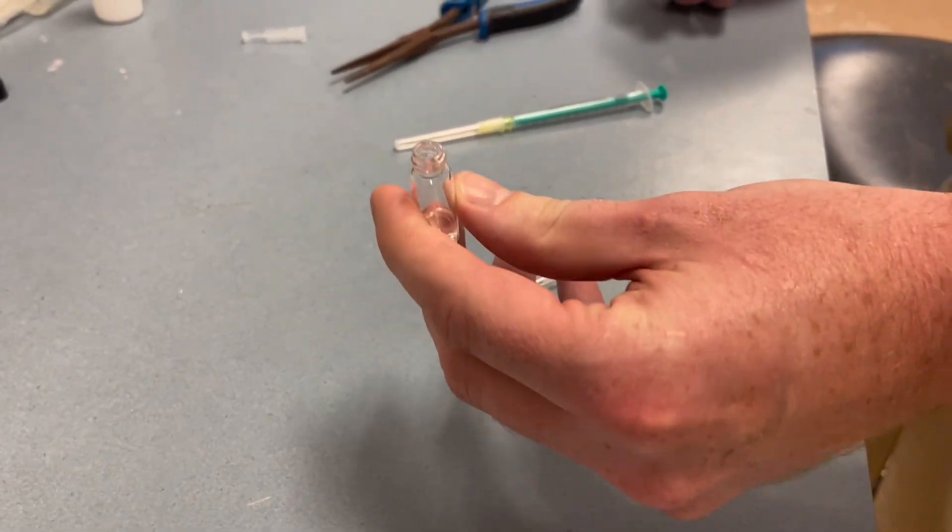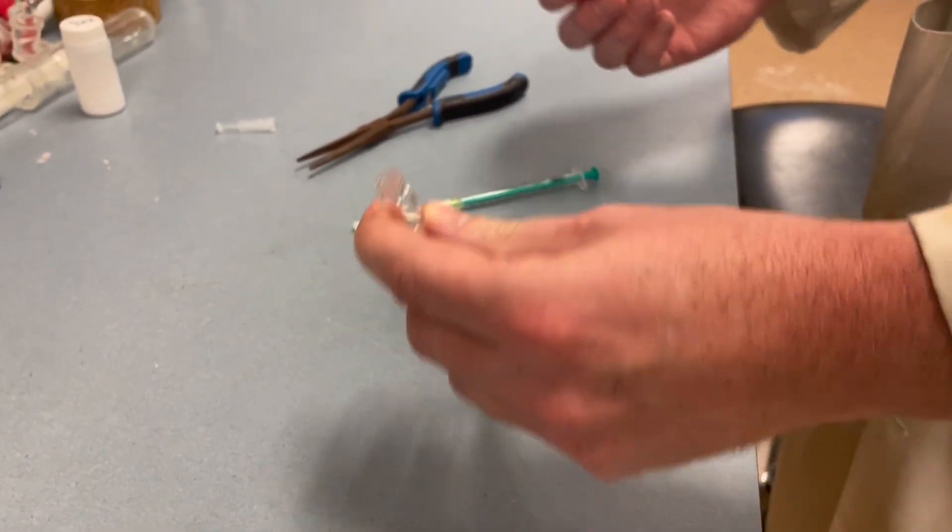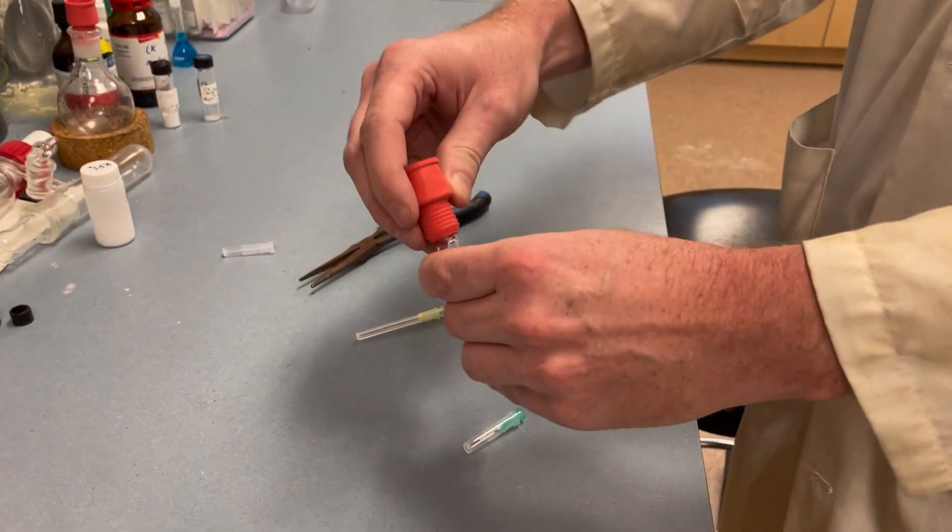So what I'm going to do is demonstrate how to effectively and safely set this up and attach it to the rotovap.